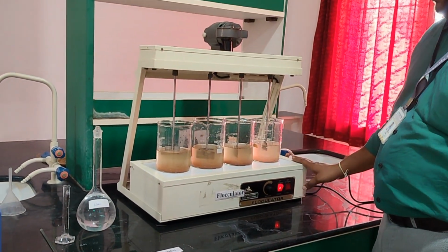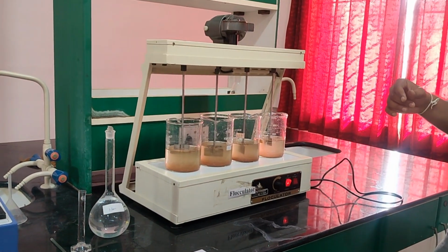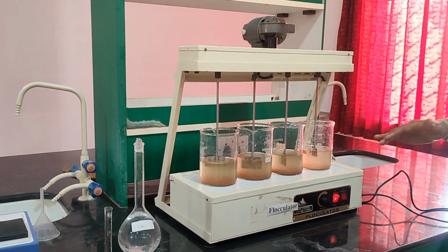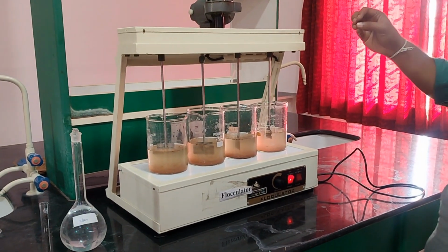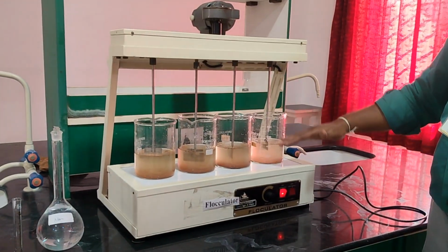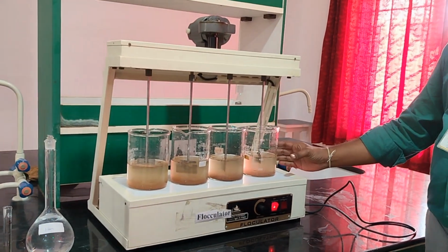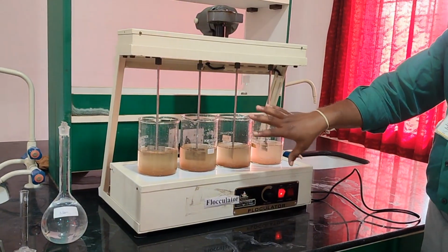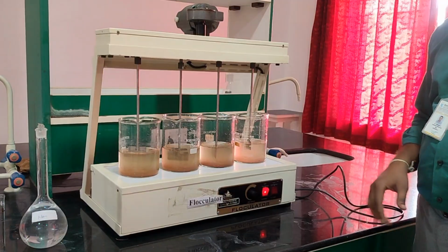Right, now the machine is ready, and we can leave it to flocculate for around 25 to 30 minutes and allow the particles to settle down. What happens is, when alum is in this water sample, it neutralizes the charge of the particles so they settle down very easily. This is the process alum does. Whenever we get water with turbidity, the turbidity can be reduced by adding alum. Here we are going to identify the optimum value of alum to reduce this waste and settle it down in the tank.